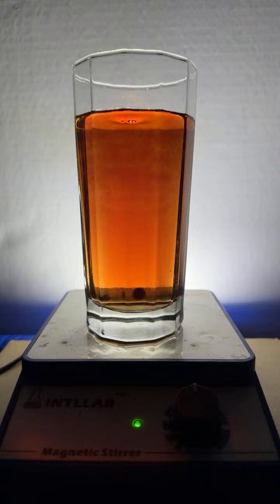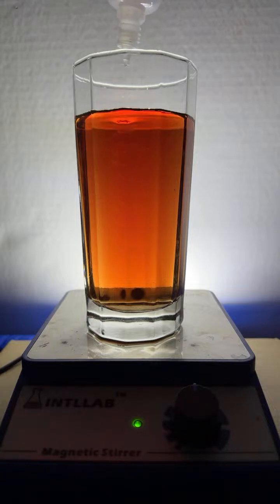The stir bar is not the greatest. It's kind of like, I don't know what to call that, like a wine, like a sunset. So there's your base color. That's fairly basic at this point. And now I'll add some acid and we'll see what happens in the other direction.